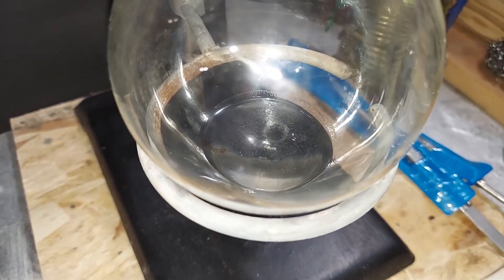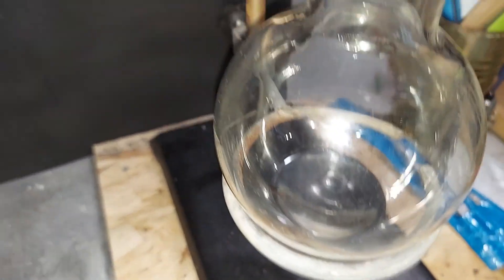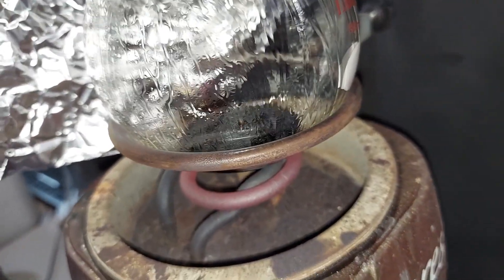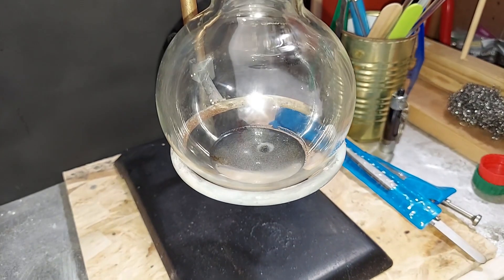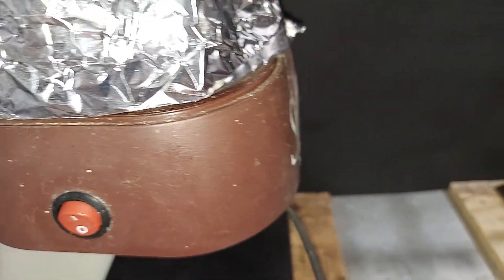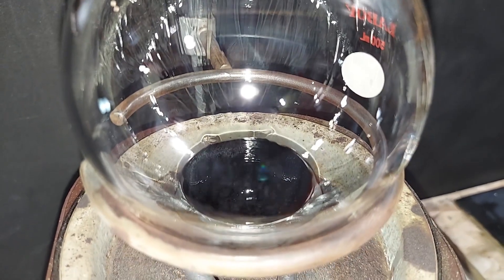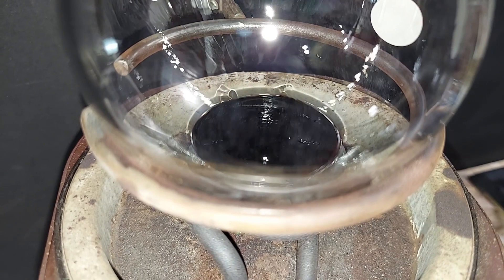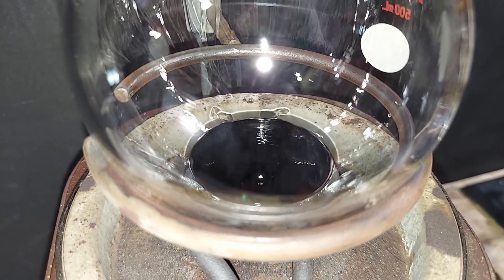It's been about a half hour since I started and there's maybe 2 to 3 milliliters of phenol. Because of what's happening on the other side — the black tarry substance heating up and sticking — I may end this before it's completely done distilling. There hasn't been any phenol coming over for quite a while, so I'm going to turn this off and let it cool down. As it cools you can see small droplets of phenol still in there — obviously some phenol remains. Having done this previously, I know it smells a little bit like turpentine.